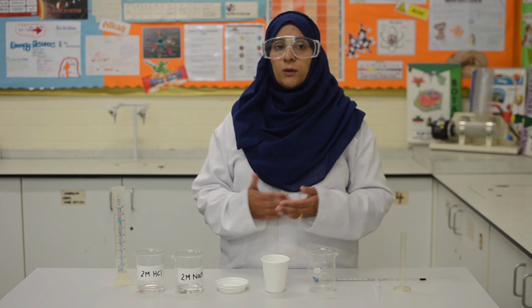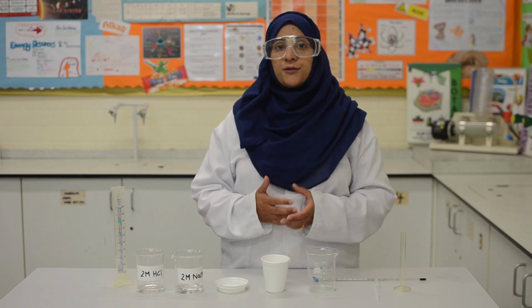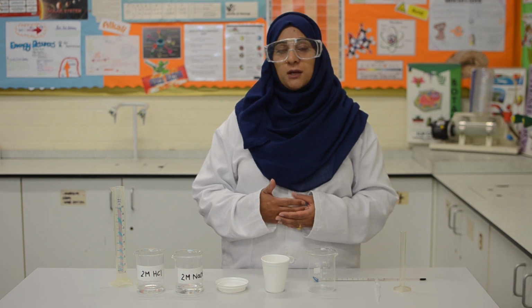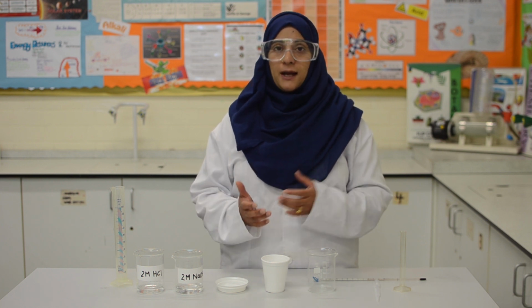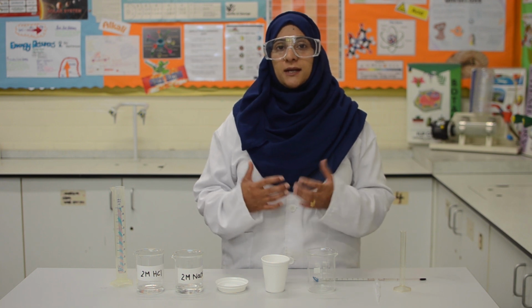Today's practical is on temperature changes, which is one of the required practicals for GCSE chemistry. In this practical, we will be looking at temperature changes in an exothermic reaction through the neutralization reaction between sodium hydroxide and hydrochloric acid. Reactions can be exothermic and endothermic. In exothermic reactions, the energy produced is released to the surroundings. And in an endothermic reaction, energy is absorbed from the surroundings.